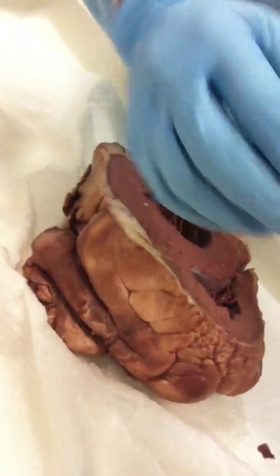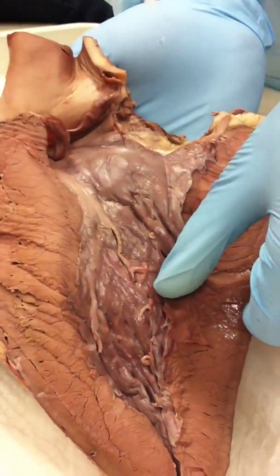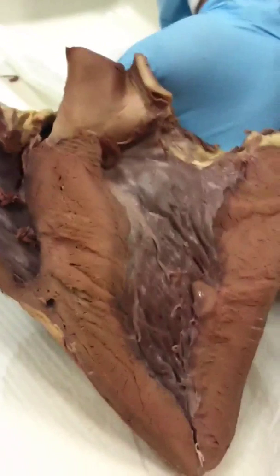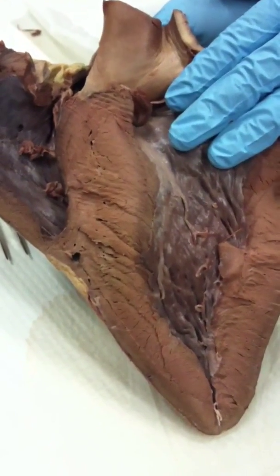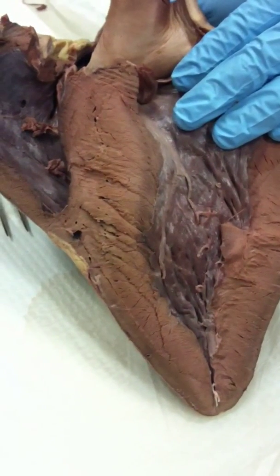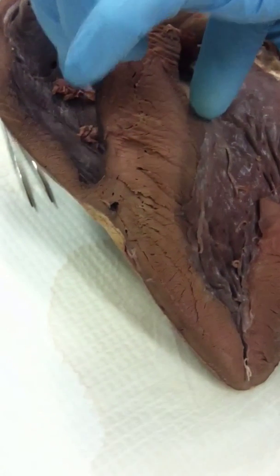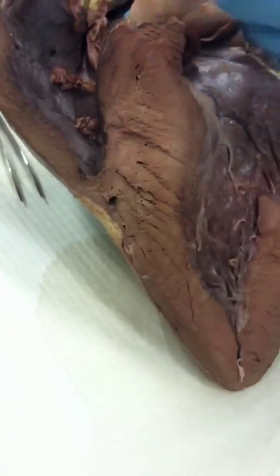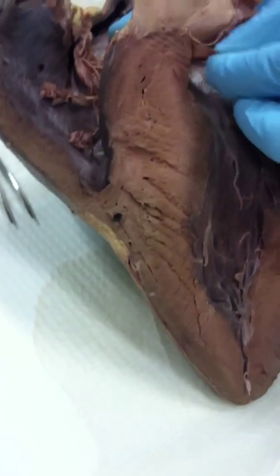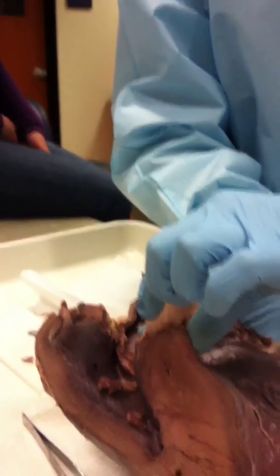here where you have a cow that has actually a very large interventricular septum compared to the left ventricular wall. This is also a common disease that you see in kids. This is like, if you ever hear a story about a basketball player in high school that just dropped dead during practice or a game, it's usually because they have a hypertrophic interventricular septum. The problem with this being too thick, it actually blocks the semilunar valve, the aortic valve, from functioning properly. And it can impinge on the coronary arteries.